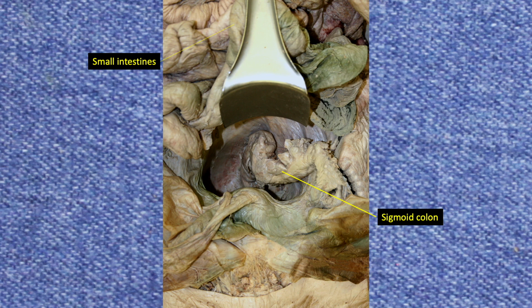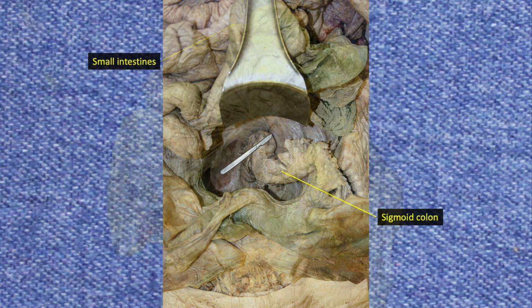The first goal of the dissection is to tie off the sigmoid colon as low as possible and cut it to leave a free end. Ultimately, in this dissection, we will remove the intact GI tract to gain access to the retroperitoneal organs.